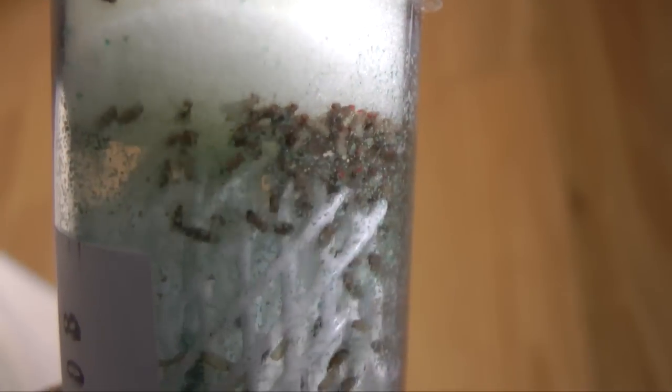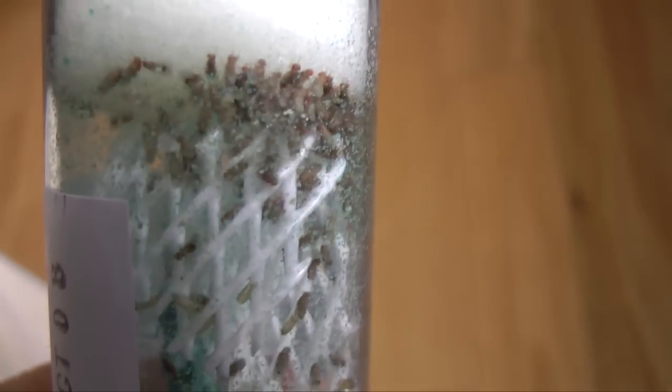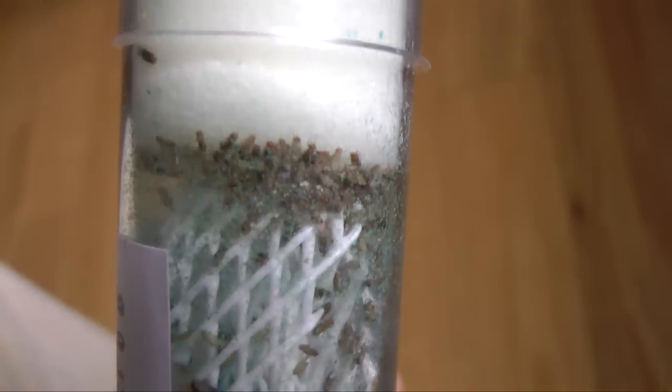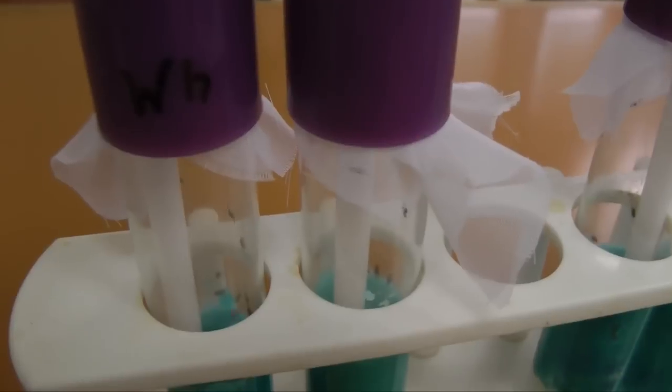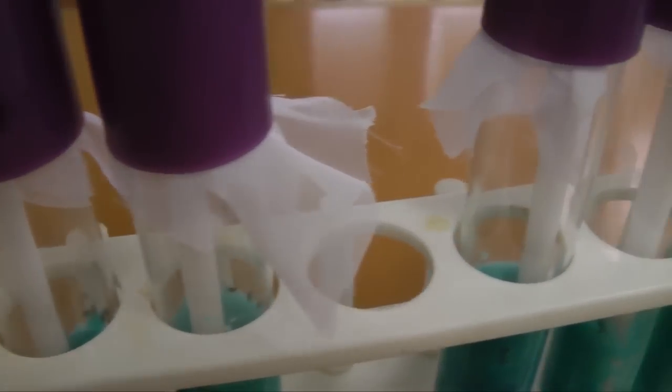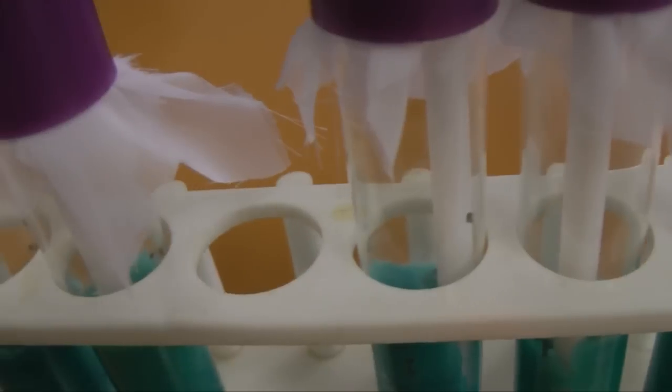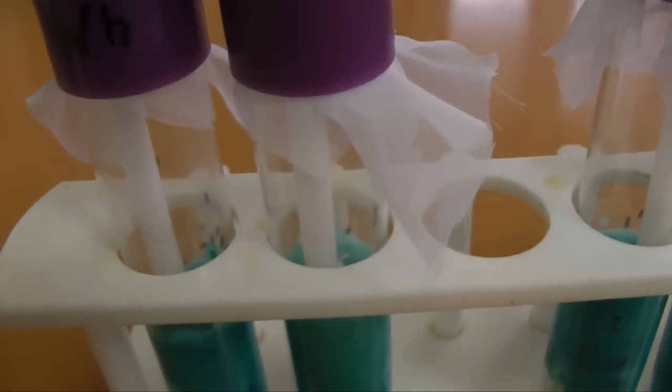The fly population will grow rapidly. To avoid crowding, you will want to divide them into fresh culture tubes, although many other types of container will do. Make sure fresh air can enter the container and the flies can't escape.